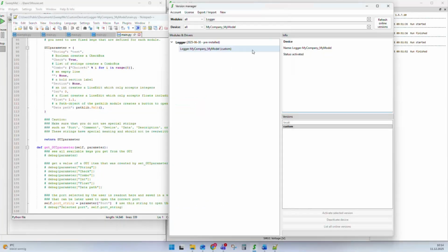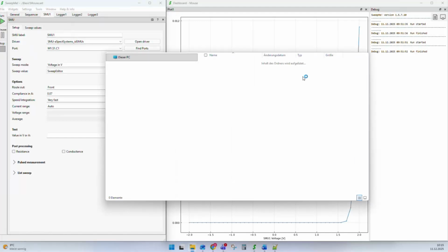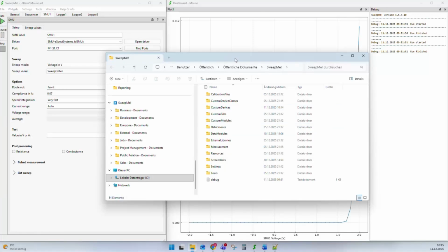So the next possibility to get a driver is to go to File, Open Folder, and we go to the public folder of SweepMe. The public folder of SweepMe is a folder where we store a lot of additional data that is specific to your setup and to how you work with SweepMe.